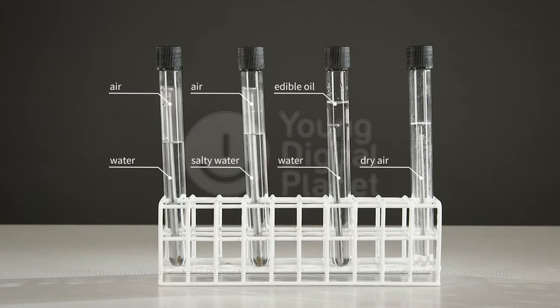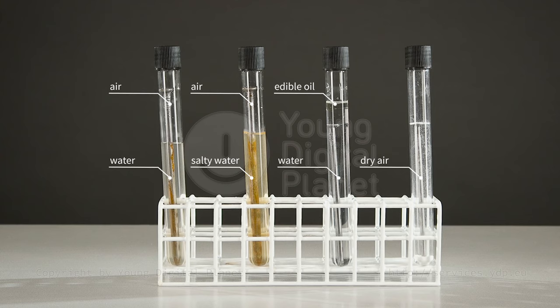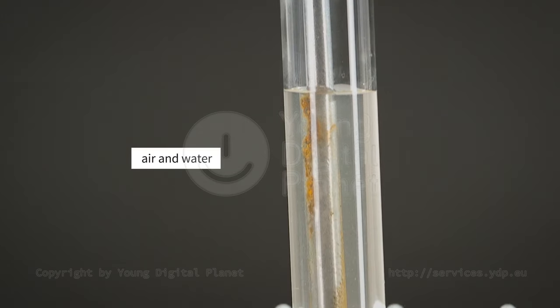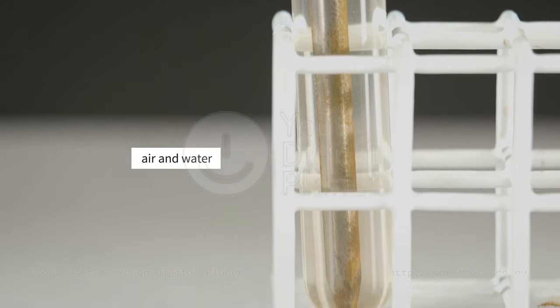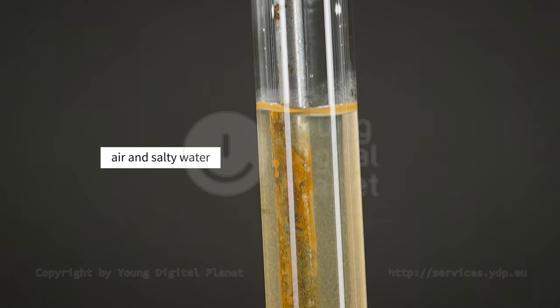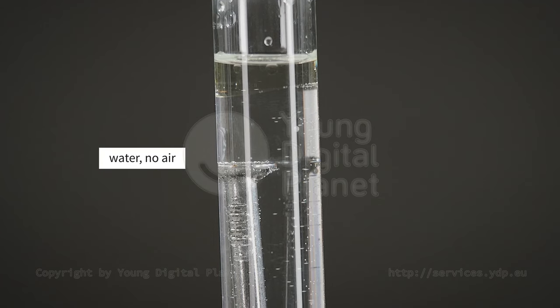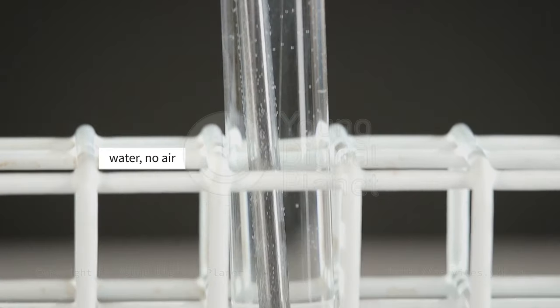If we examine the contents of the test tubes afterwards, we'll see certain changes. In the first and second test tubes, the nails were in contact with air and water, so they become covered in rust. However, no rust formed in the third and fourth test tubes.